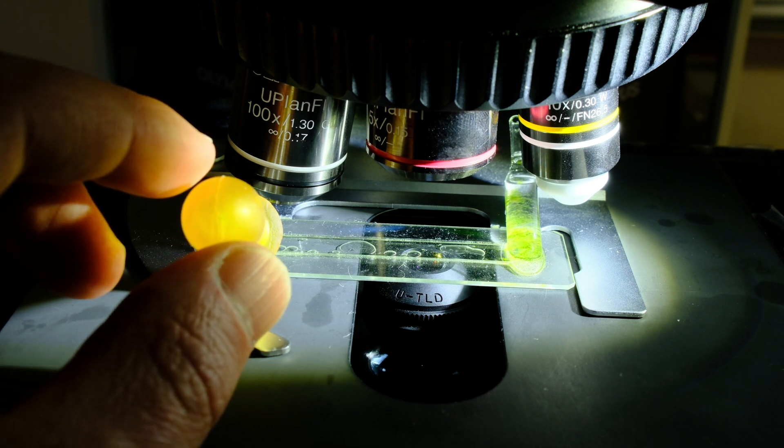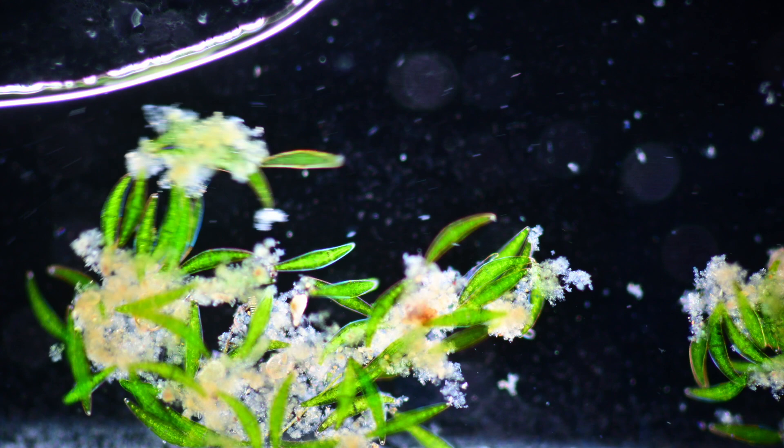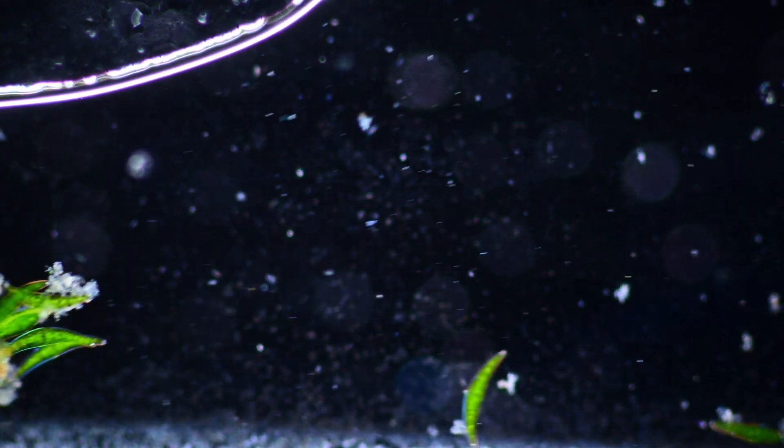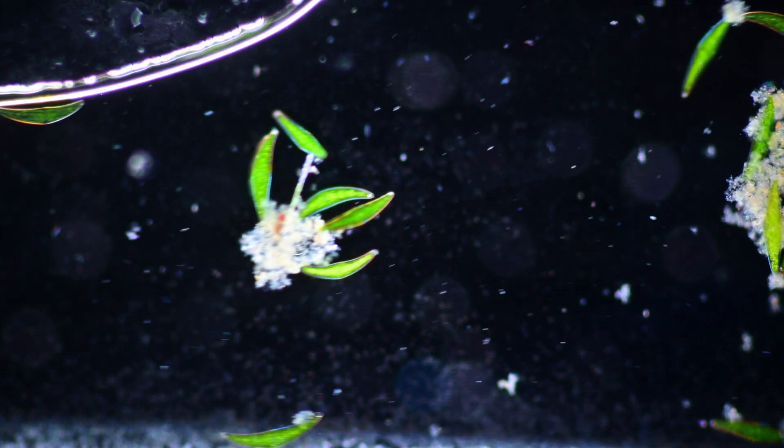You can get a better grasp of the three-dimensional structure of the objects you're looking at, or you can get a nice overview of all the organisms within your sample. You just move it micron by micron.